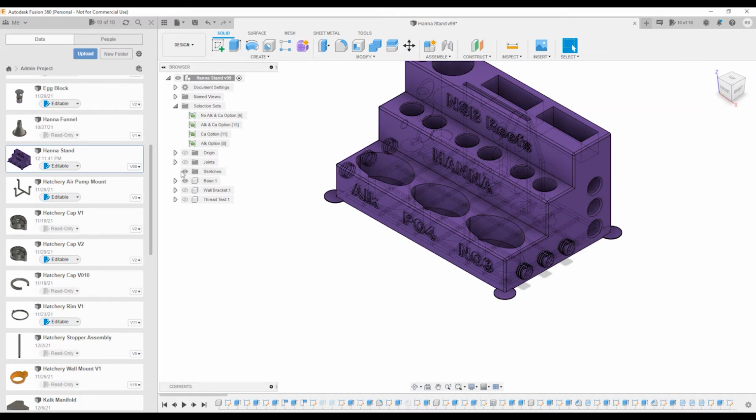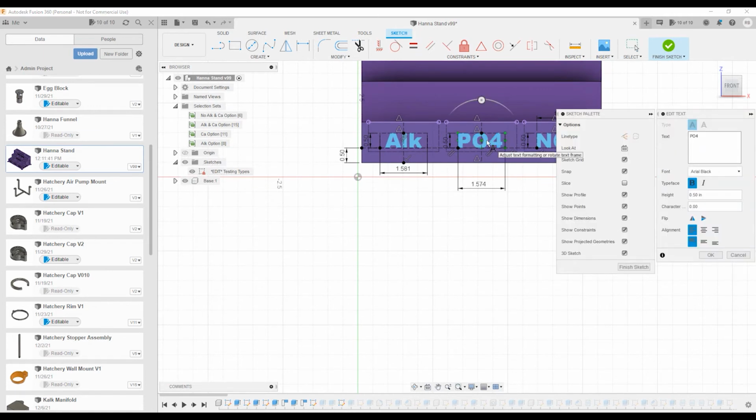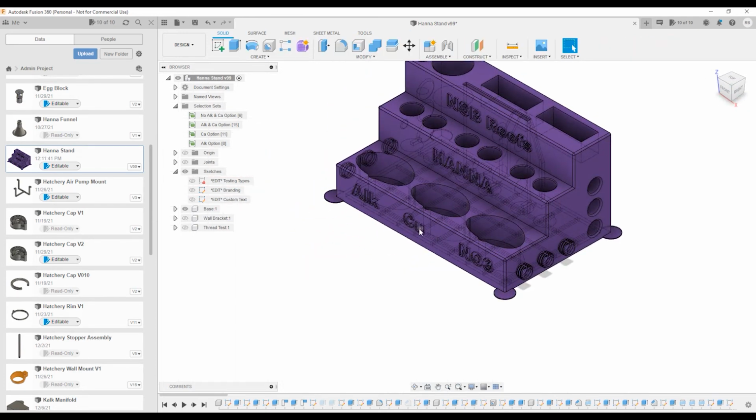In the assembly area, for convenience, I've located the sketches for those there. So I'll expand that. And you can see where it says testing types. Double click on that. Double click on the sketch for that. And then up here, we just type in CU for copper. And then finish sketch. And you can see now it's changed to that.